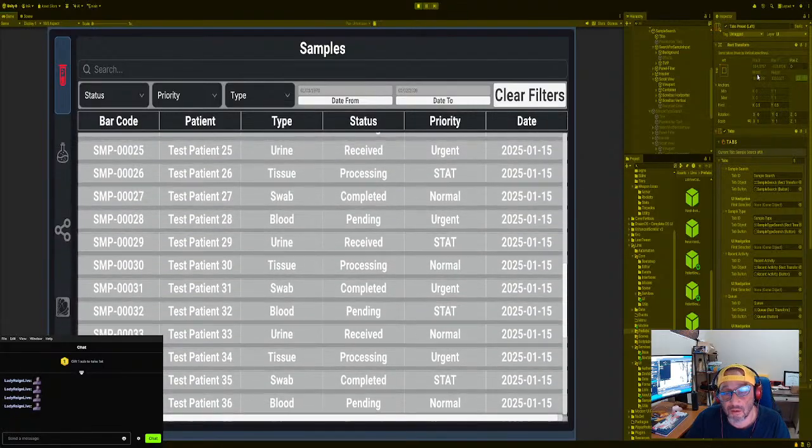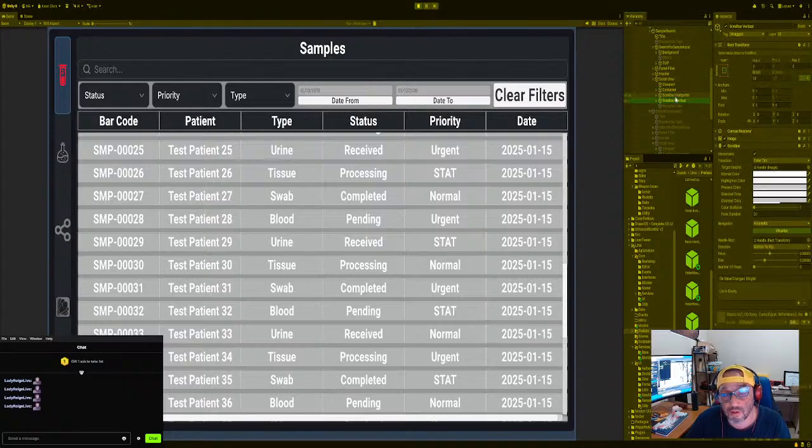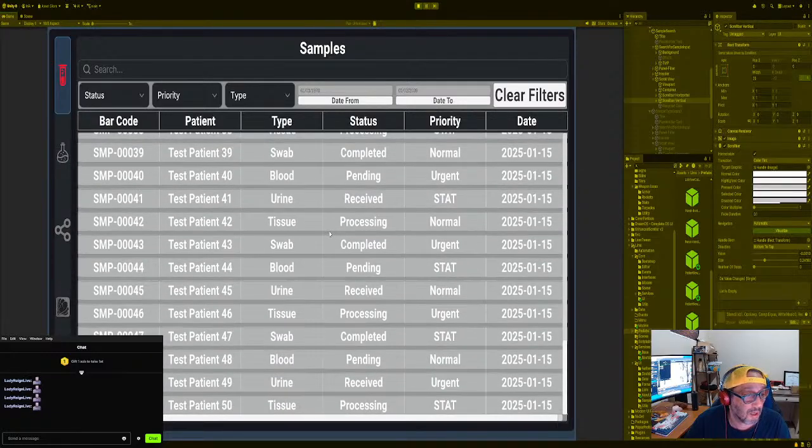But how do we do this, right? We need to make sure that the container in the script goes before the vertical and horizontal layout script. I don't know how to do that dynamically right now, so we have to look that up. So that's just one issue that I saw.